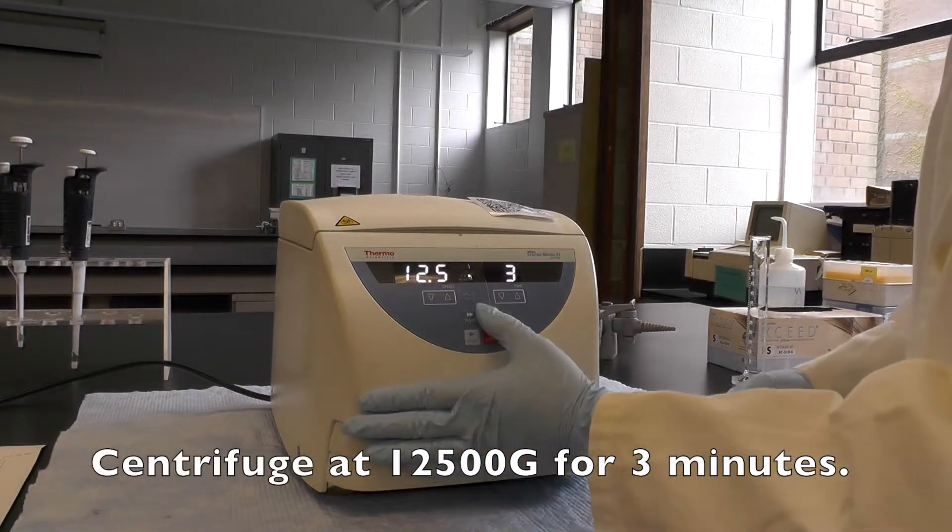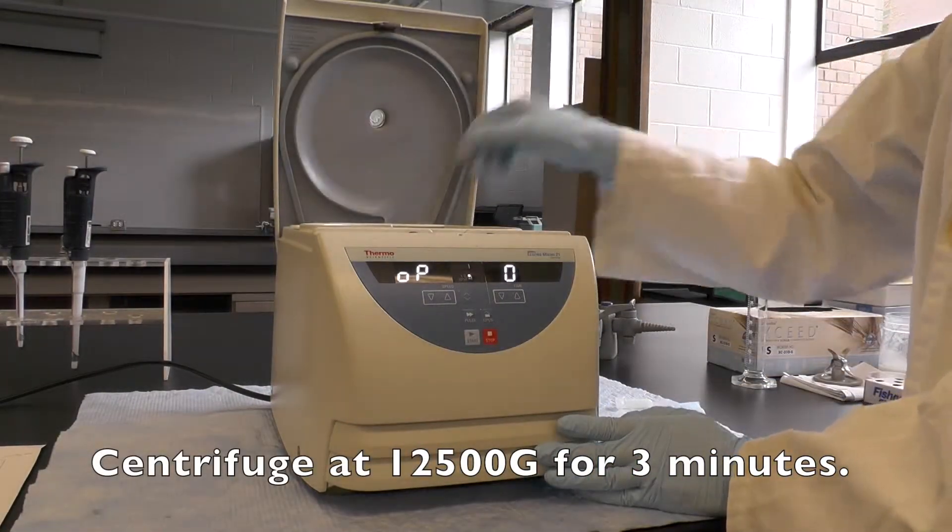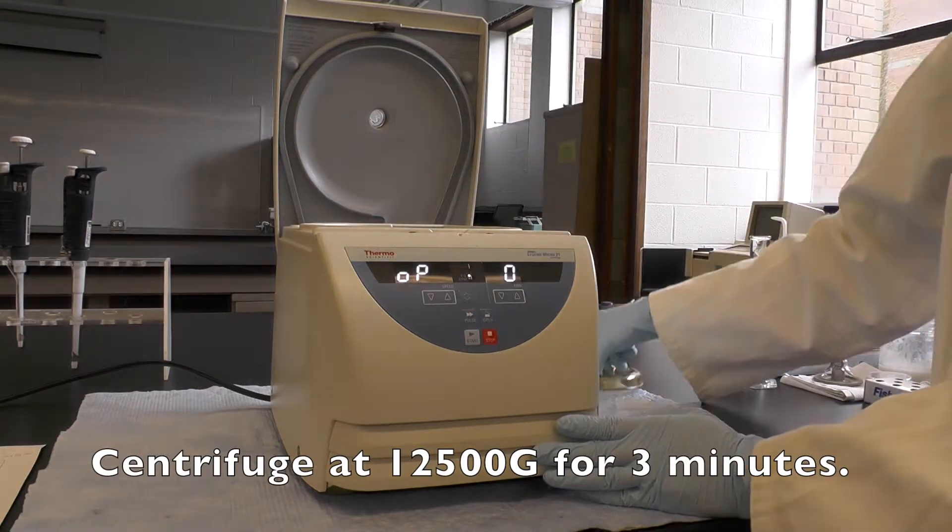Centrifuge for 3 minutes at 12,500 g. Make sure the centrifuge is balanced when you're doing this.